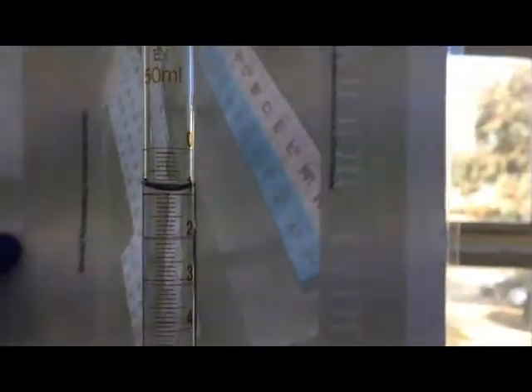Our titer value, remember we read from zero to 50, and so we read from the bottom of the meniscus. Actually, this is sitting a little bit above one, but that's okay because I'm going to get rid of a tiny drop before we start. Starting off at about one.